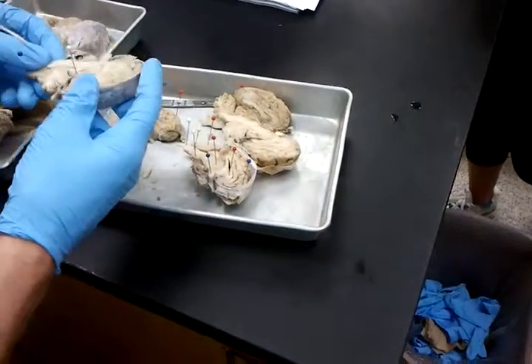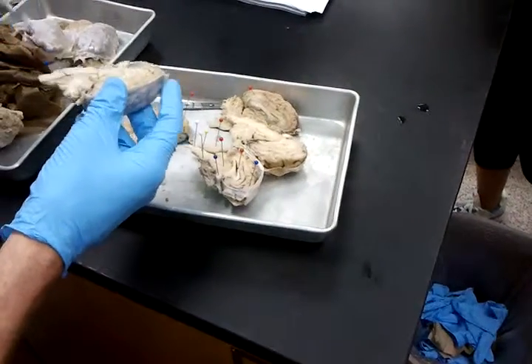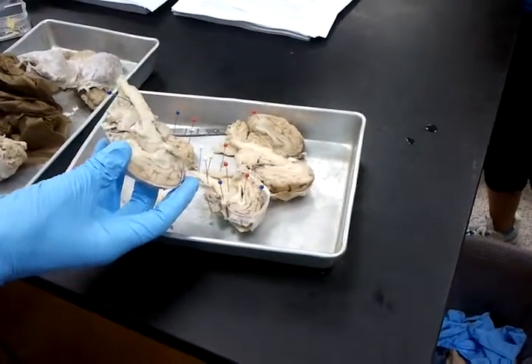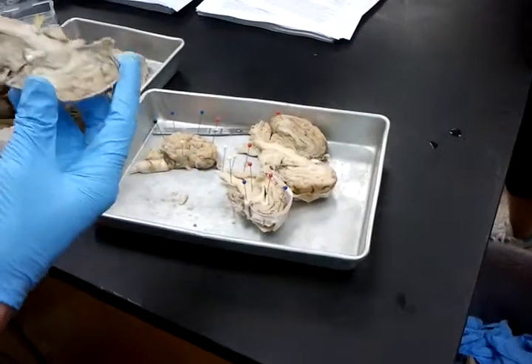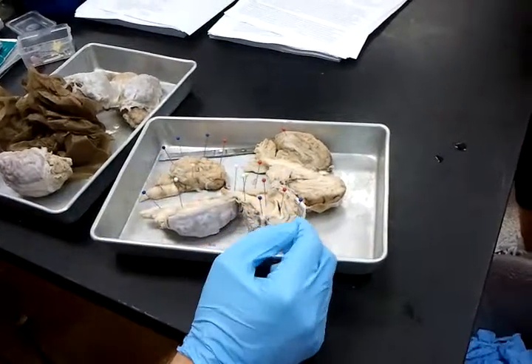The fourth ventricle pretty much exists between the medulla oblongata and the brainstem and the cerebellum. So see how it's pinned right there? That's how I'm asking about the fourth ventricle. And again, I'll have the question delineated which ventricle I'm looking for.